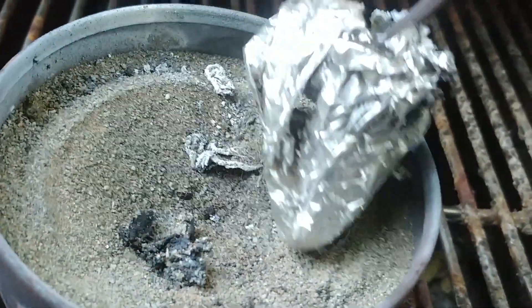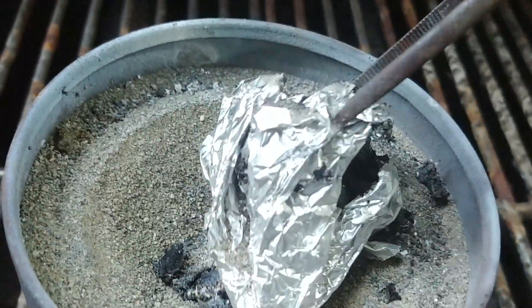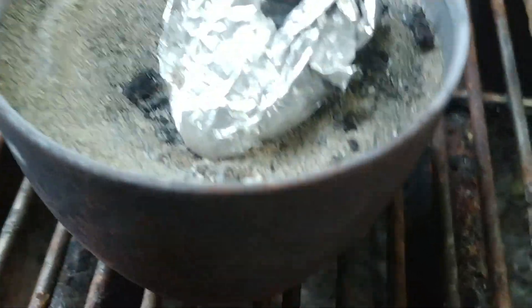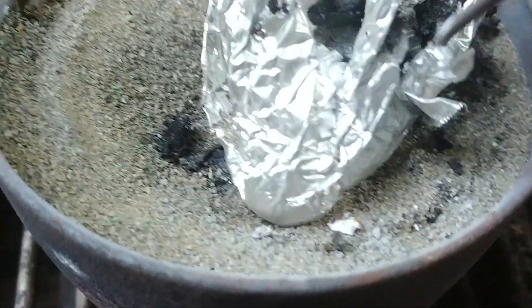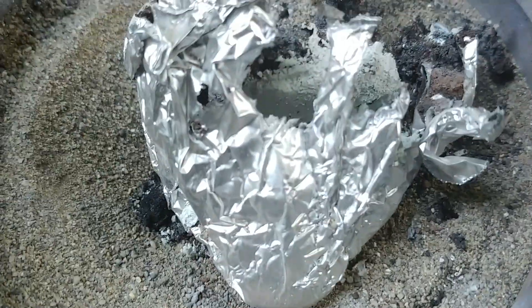It came out in one solid piece for the most part. Inside here it did not burn all the way through, so there's gonna be some of the aluminum oxide and chromium oxide mixed left. So you might actually have a chance at seeing some red material. I've also got my black light flashlight here.